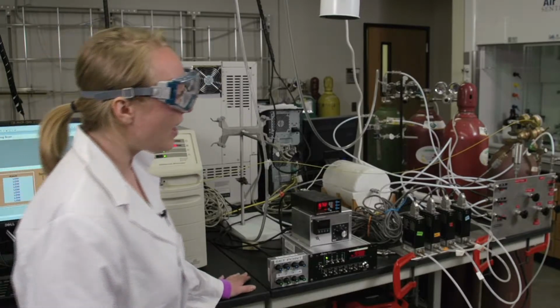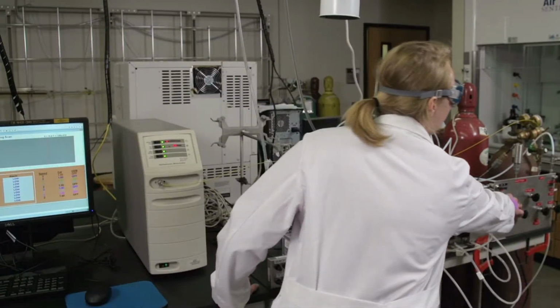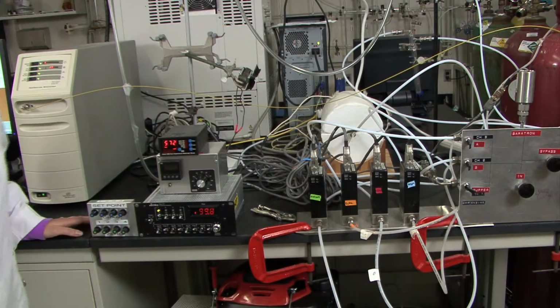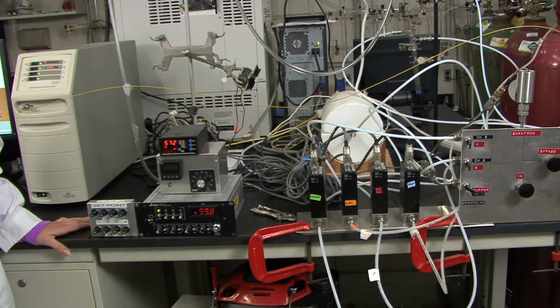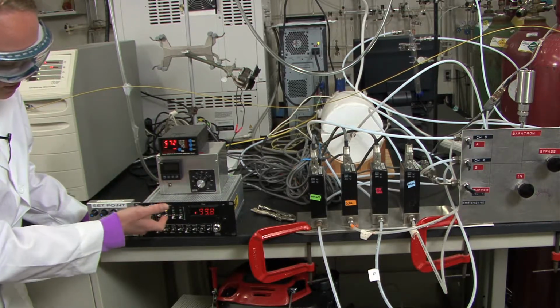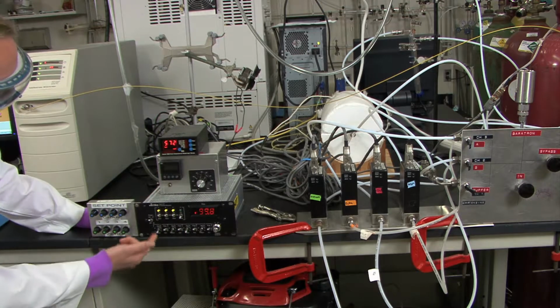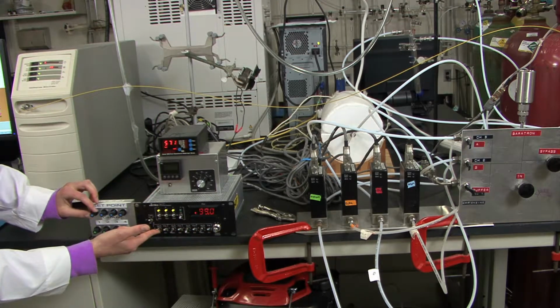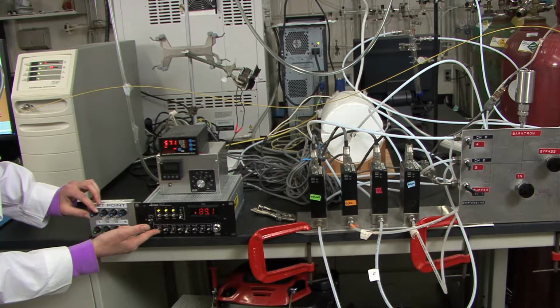So to turn on the oxygen and ethylene lines, you'll need to flip the second and third switches. And the second goes to oxygen, the third goes to ethylene. And then you'll need to set this on the 247 channel readout. So you'll need to turn on channels 2 and 3, and then you'll want to set the point for argon back down to 80.